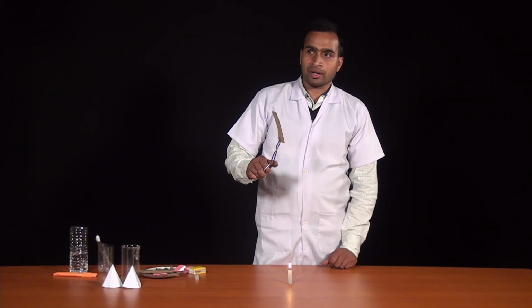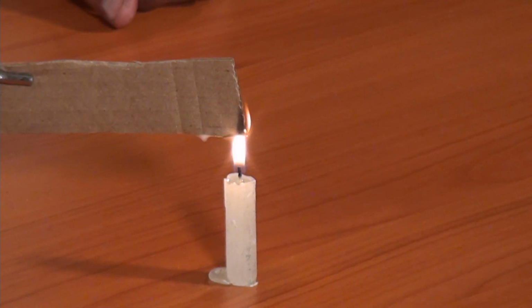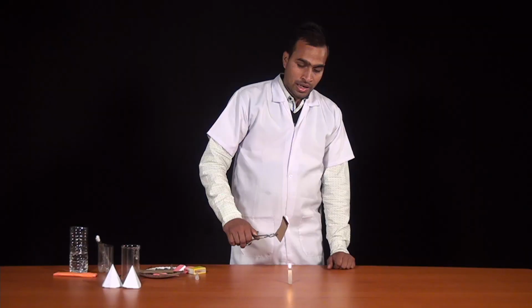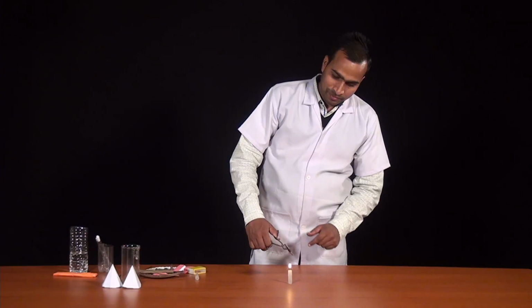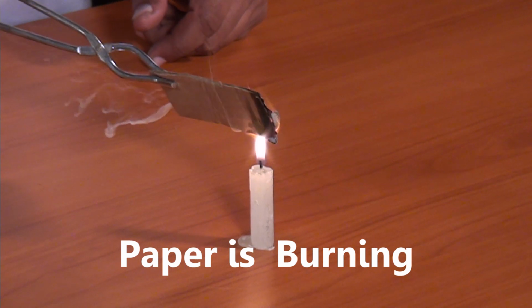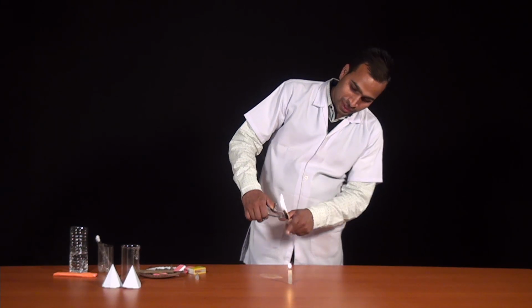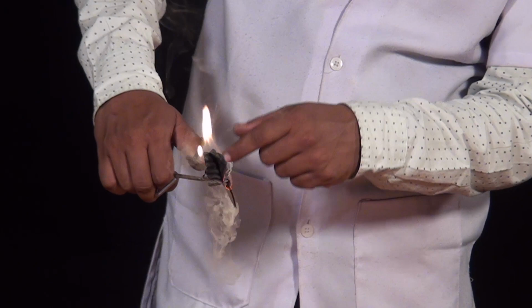This is a piece of paper. Let's try to burn this. You can see that this paper is burning, and some kind of flame is produced, and smoke is also produced from the burning of this substance. You can see that there is production of smoke. On this side smoke is produced and here flame is produced.